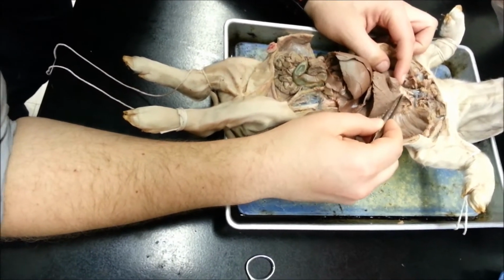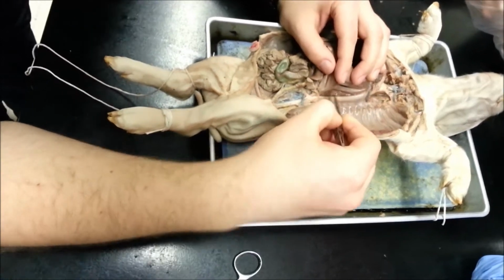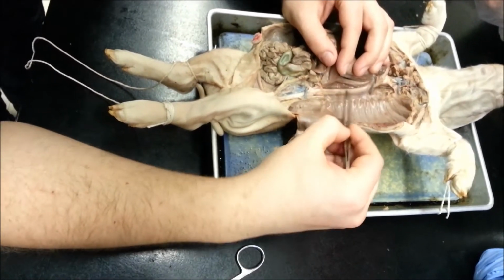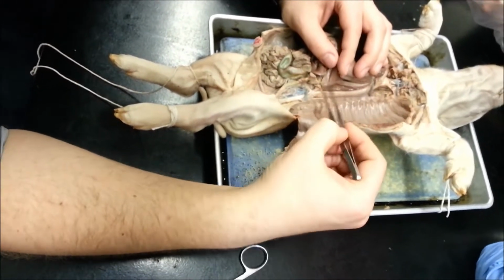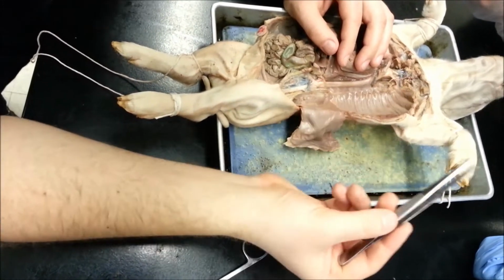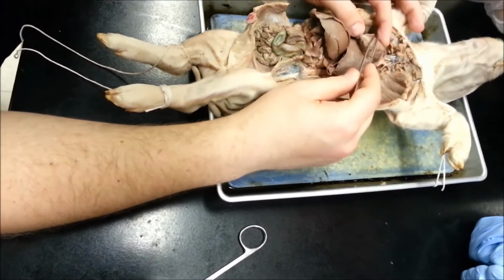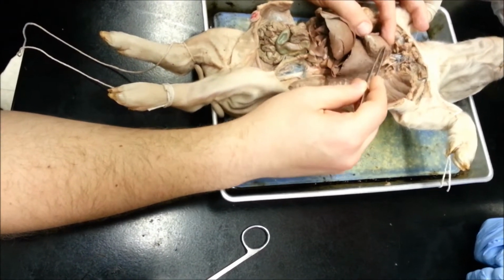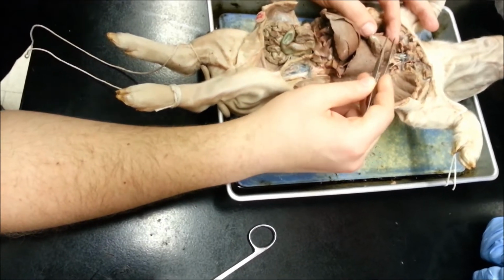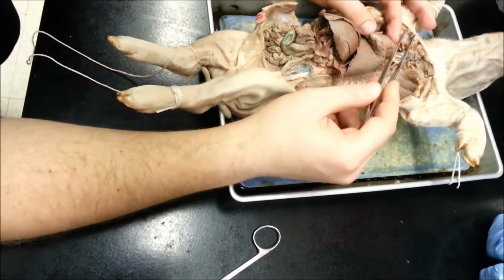This part of it is called the aortic arch, and it continues all the way down to the systemic aorta. So this whole thing, anywhere you put a pin, is called the systemic aorta. Now, off the aortic arch, we have three major separations. One of them is going to be the coronary arteries, which, as you can see clearly on the pig, is on the heart, which is going to feed the heart itself, so it gets the freshest blood.